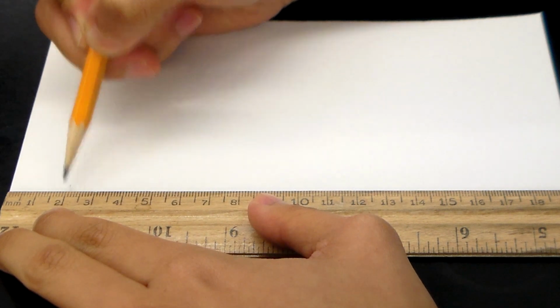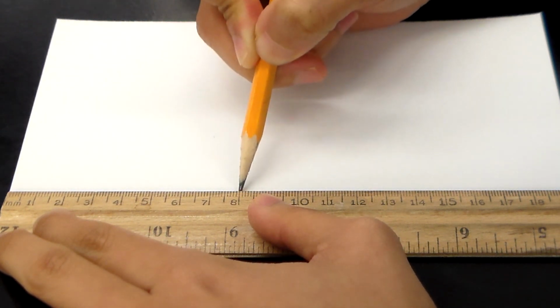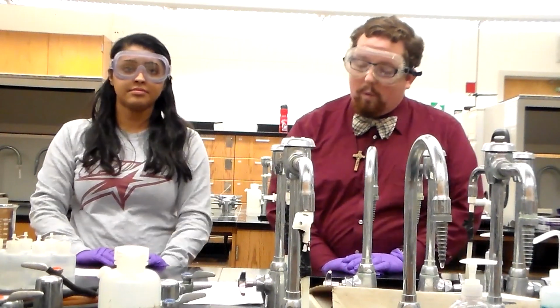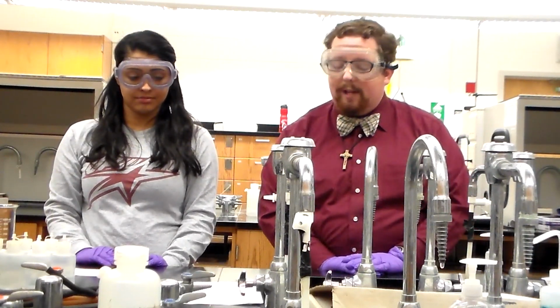Mark 9 points on the line, about 2 centimeters apart, and 2 centimeters apart from each edge. Number each spot 1 through 9. Be sure to use a pencil and not a pen. Be sure to not touch the paper more than is necessary. Gloves are recommended. While your partner preps the paper, go ahead and prep your mobile phase and your amino acid samples.